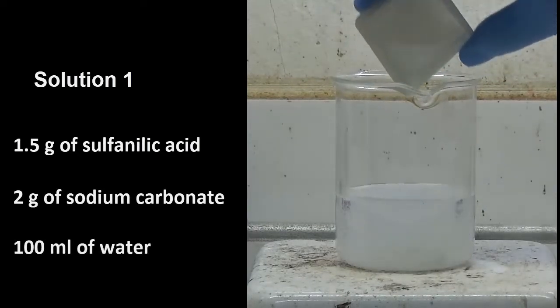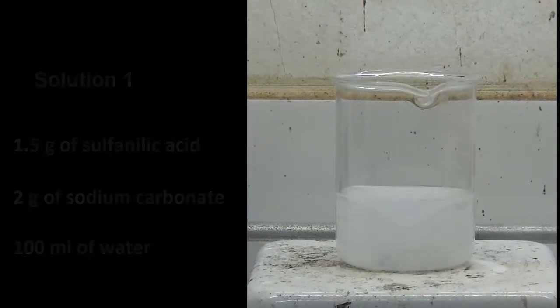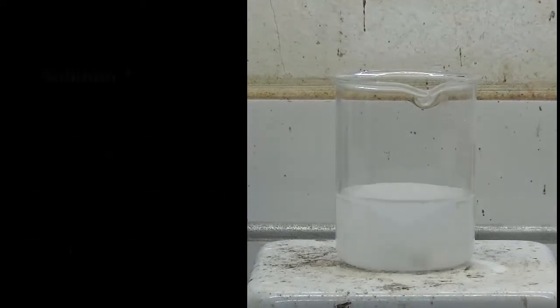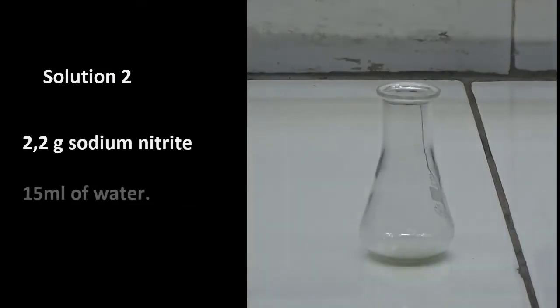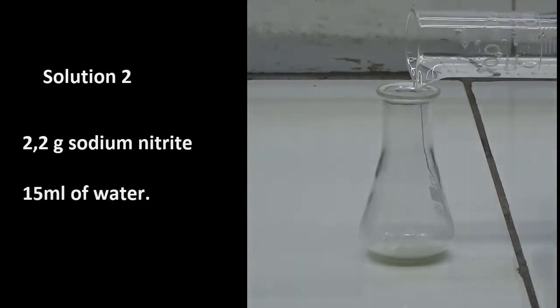Solution 2: Dissolve 2.2 grams of sodium nitrite in 15 milliliters of water.